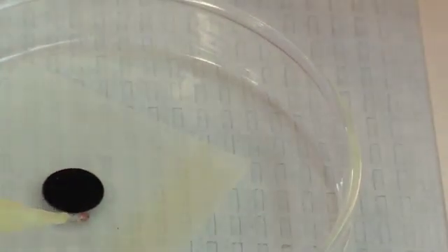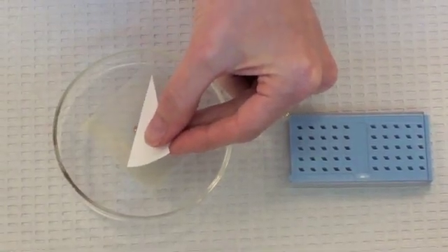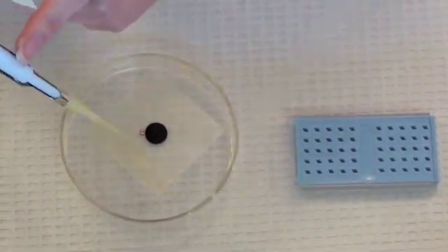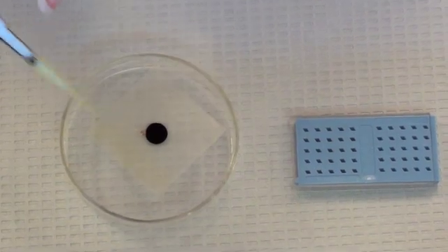And the next liquid is added immediately to keep the grid from drying. Here we watch the same process again from another view, wicking and then adding the new sample right away.